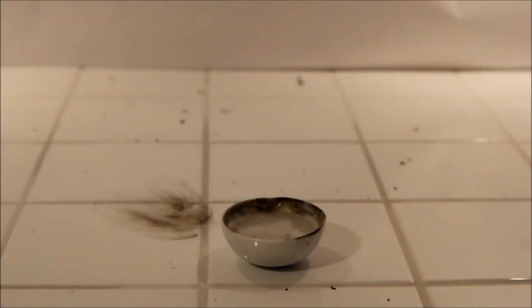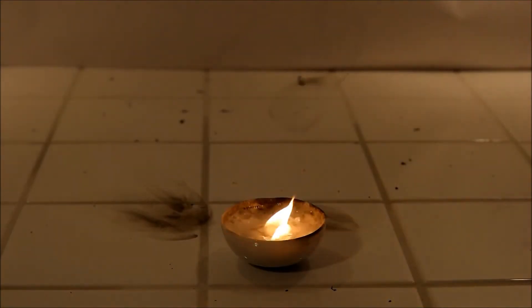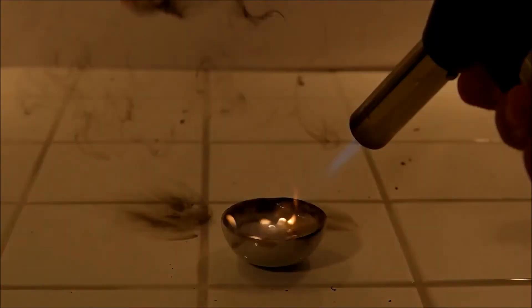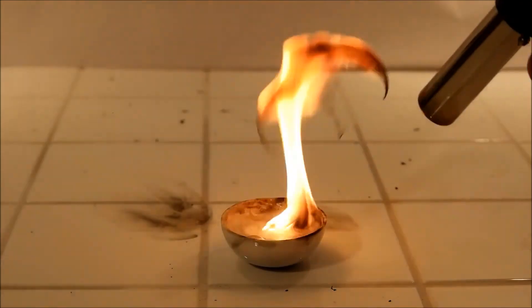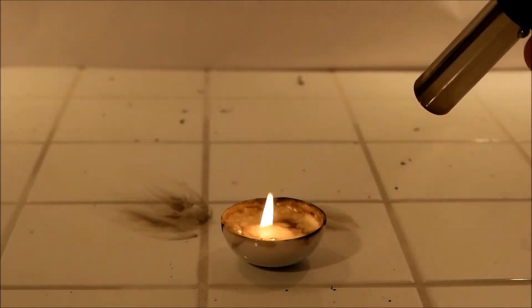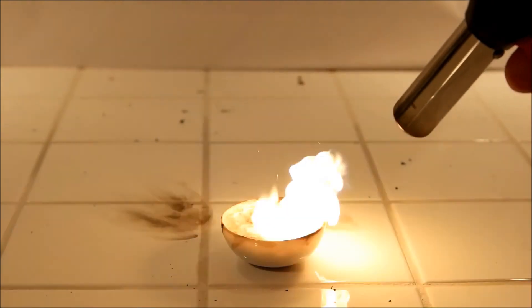And once again you can see it even explodes a bit, the bubbles explode and that's the sound.